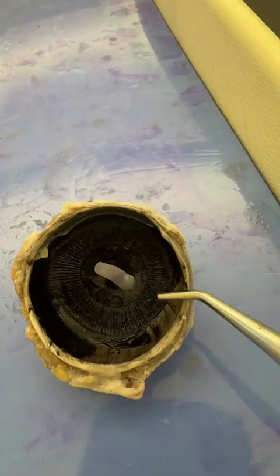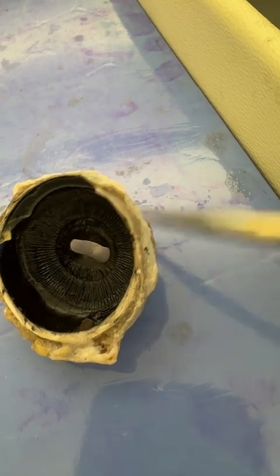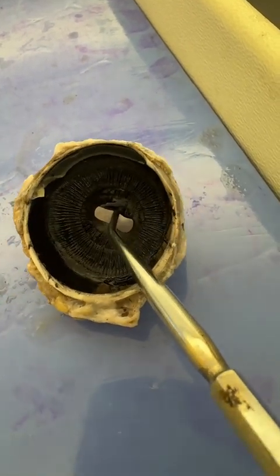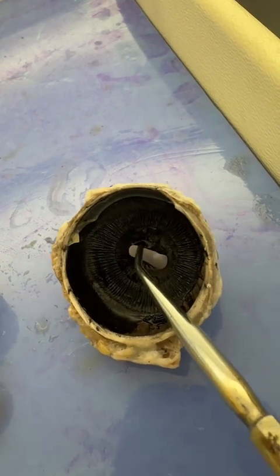All right. The back side of the front. So this, you can still see there's the cornea right there. The hole would be the pupil. And inside here, this layer, that is the iris. So the iris, the colorful part of the eye, is right in there.